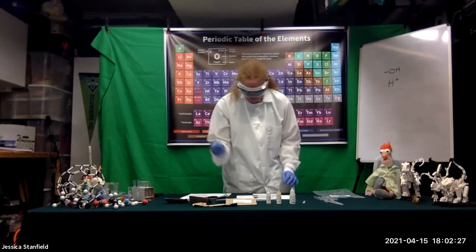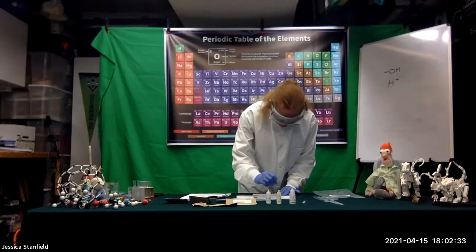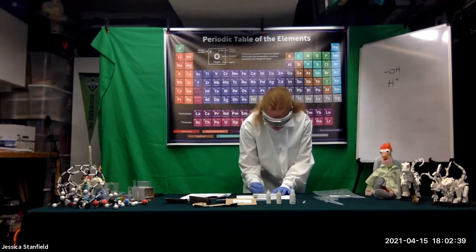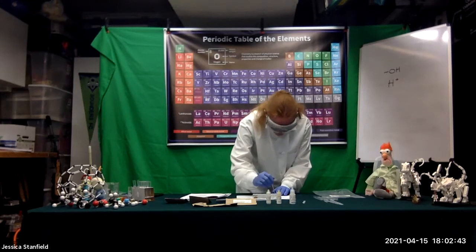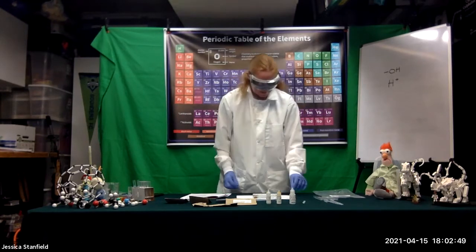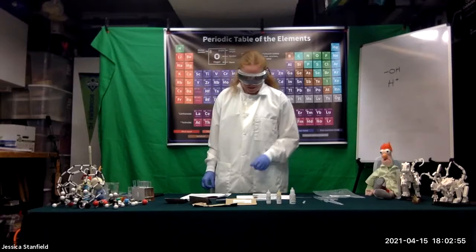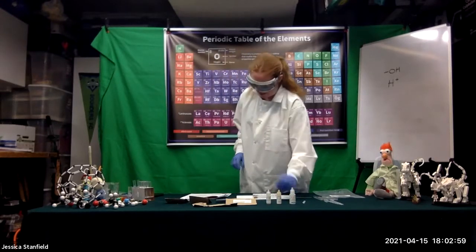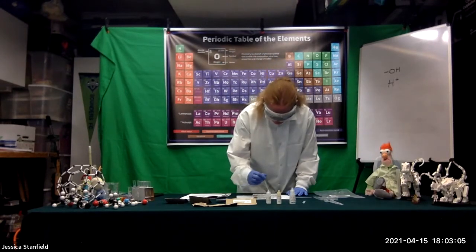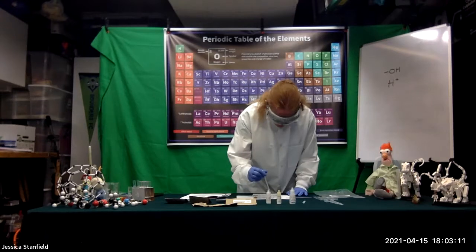Now I'm going to take the stir rod, stir around the contents of well A1 very carefully, get some on the end of my stir rod, and touch it to the pH paper. If you're having a hard time getting a good dot, you can do it a couple of times. That gives us the pH result for our salicylic acid. Now I'm going to take my ethanol pipette and transfer 10 drops of ethanol from B2 to A2.